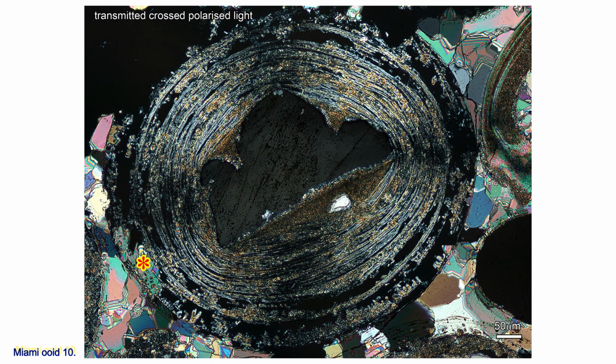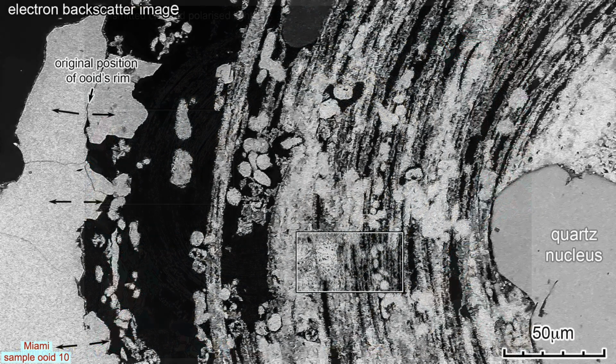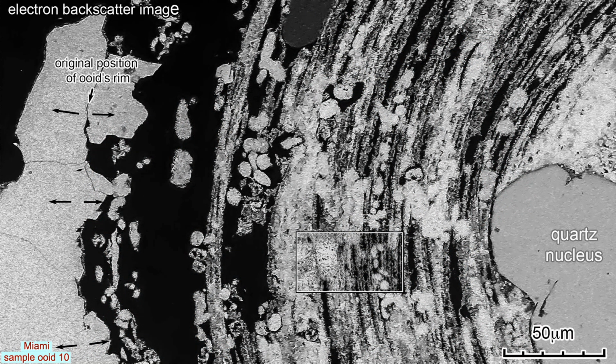Ooid 10's left margin in the box is now examined using an electron backscatter image. See how ooid 10's cortex has been ravaged by dissolution. Some of the inner cortex tangential aragonite layers have been selectively removed. While ooid 10 was still in the marine realm, its cortex was extensively bored. These borings were filled with aragonite that shows minor dissolution.